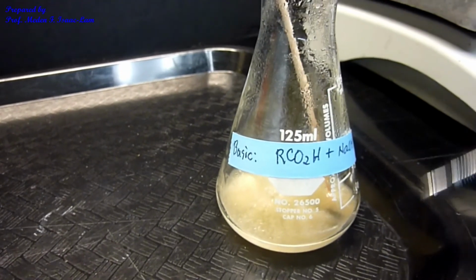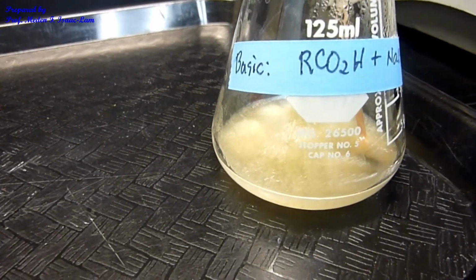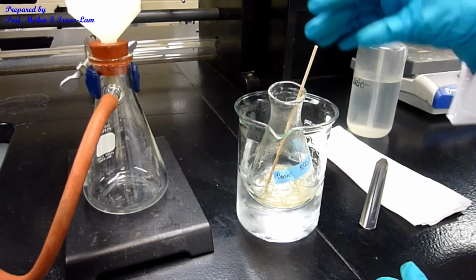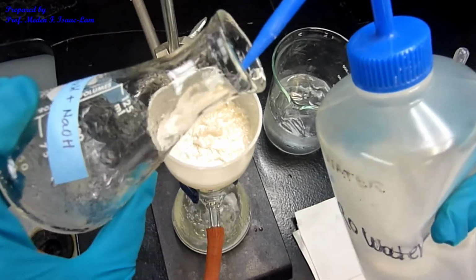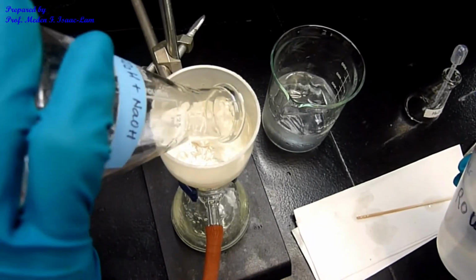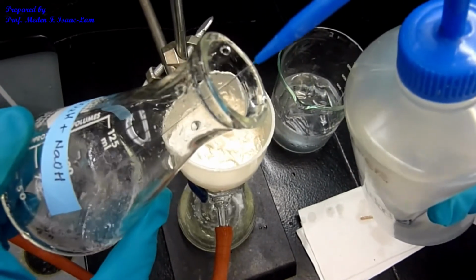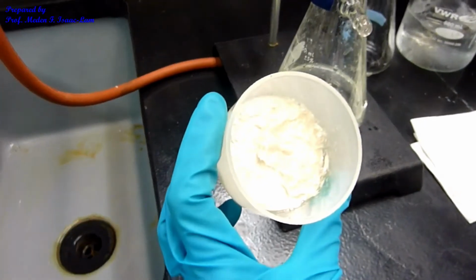The sample already crystallized out, so I'm now going to chill it again in ice water to make sure I have everything crystallized. I'll let it sit for around 5 minutes, and then we're going to do filtration. I did an extra step of recrystallizing because I want to ensure that my sample is cleaner. If I skip that step, I'm not sure that I will get a good result for the melting point determination. So that's our sample.